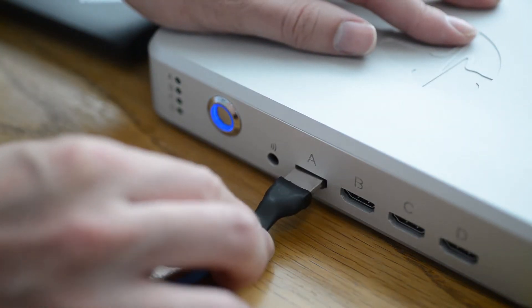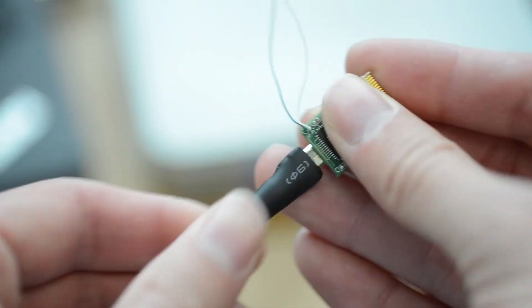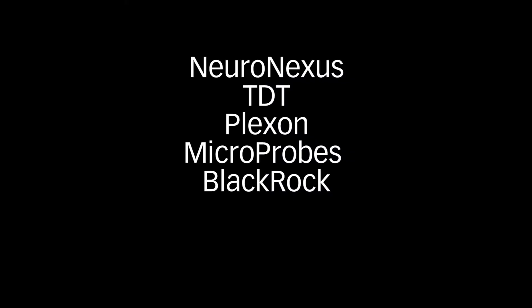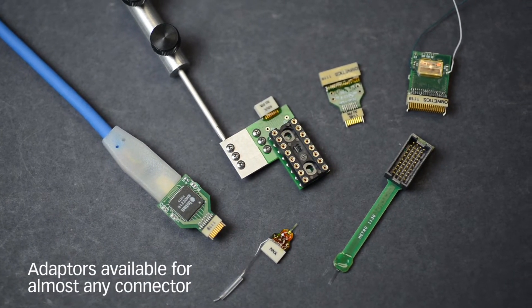Connect the HDMI cable, a smart link head stage, and probe to the smart box. The smart box can be used with any high impedance probe, including those from these companies. ECOG, EEG, EMG, and custom arrays can be used as well. If your probe connector does not match with the smart link head stage, adapters are available.